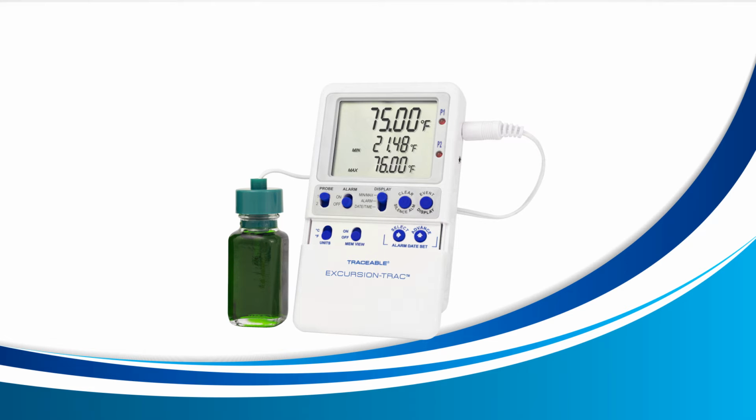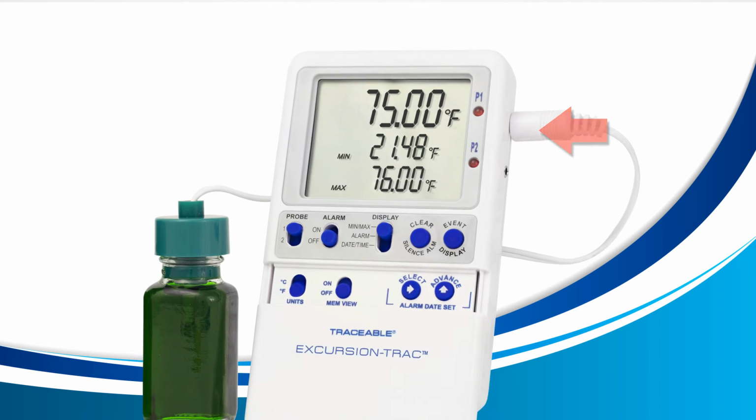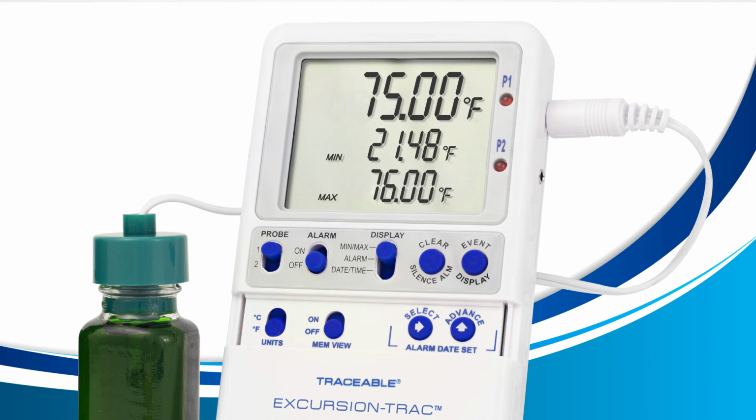Prepare your device to view alarm event history. The first thing we need to do is set our probe switch to the probe you'd like to view the alarm history for. Since I only have one probe in the P1 slot, I'm going to leave the probe switch aligned to the number 1.